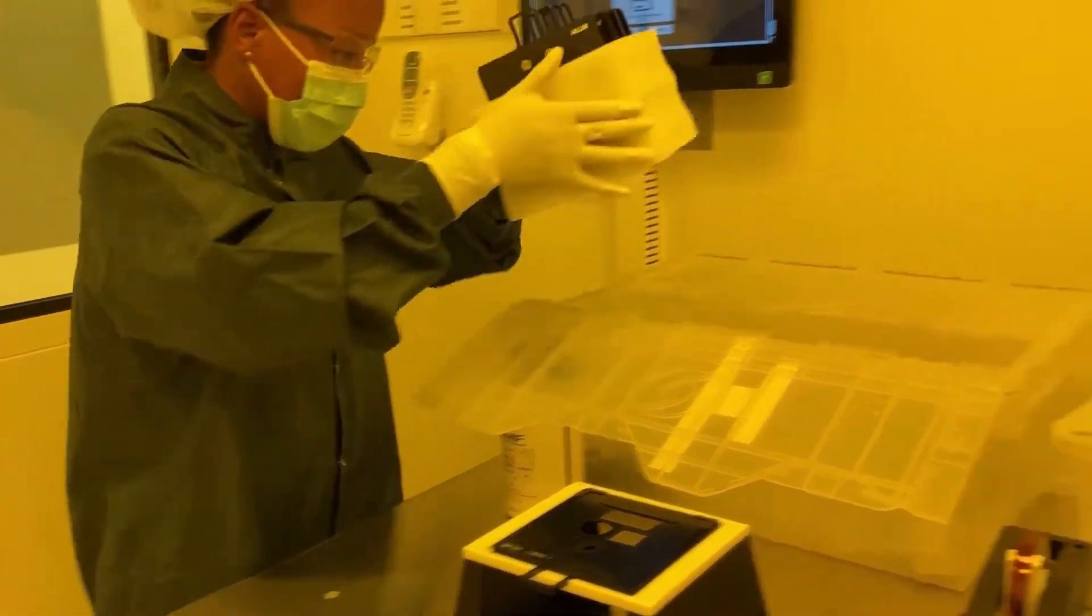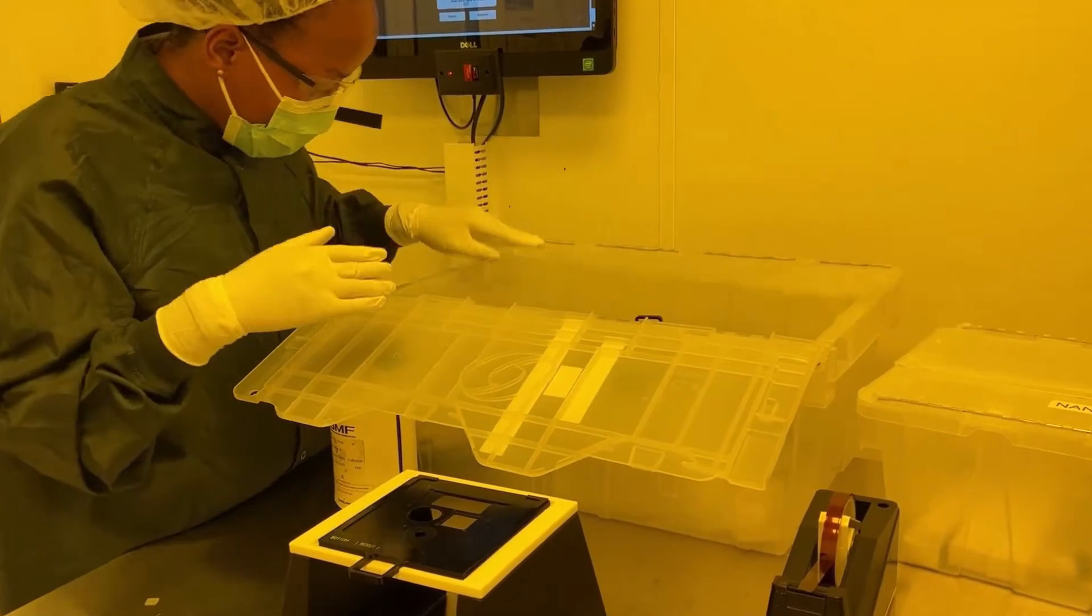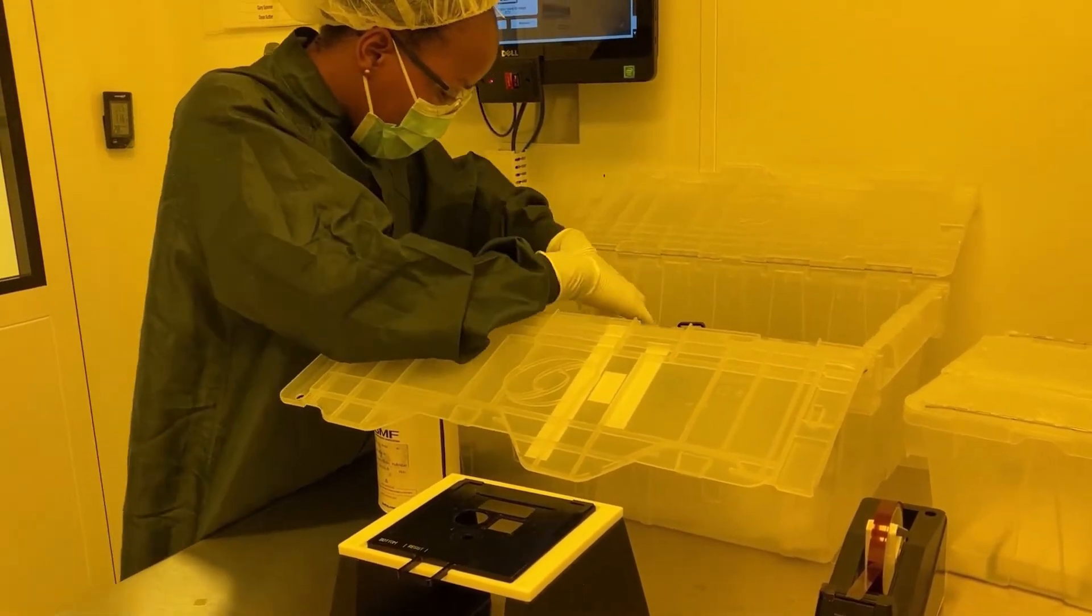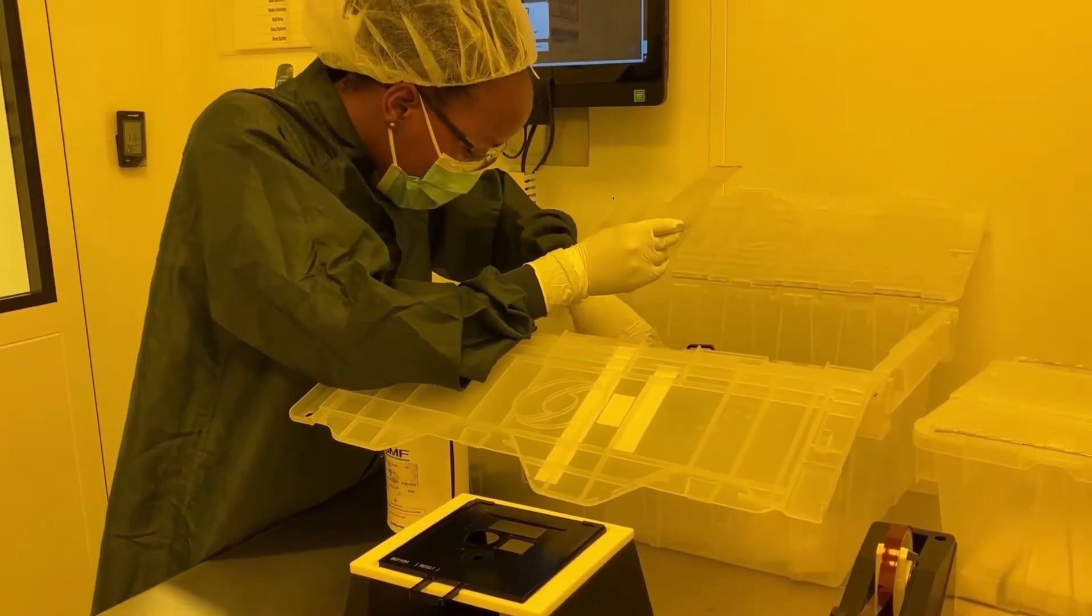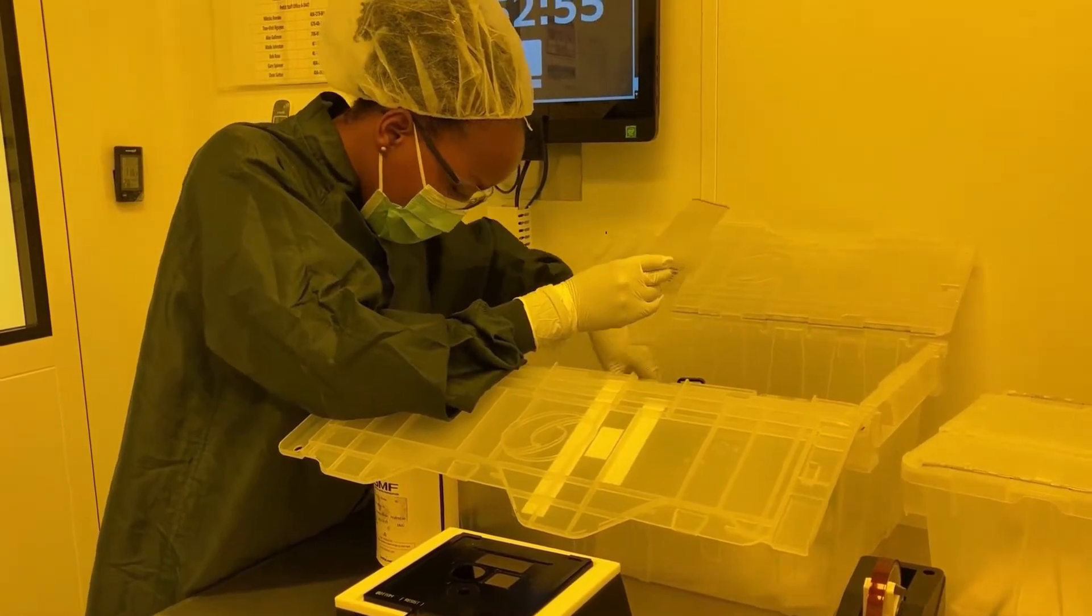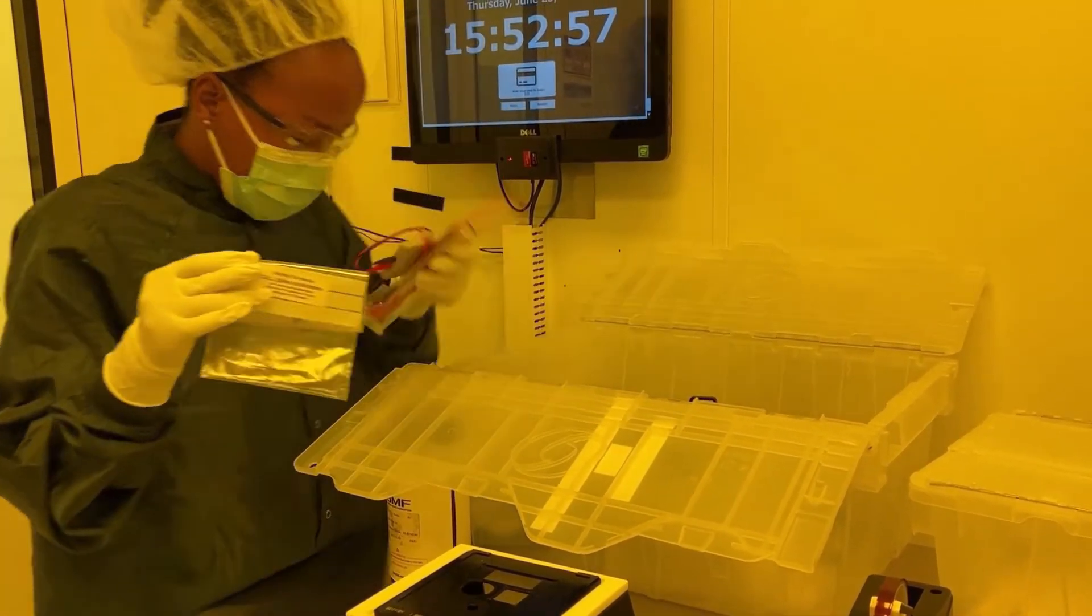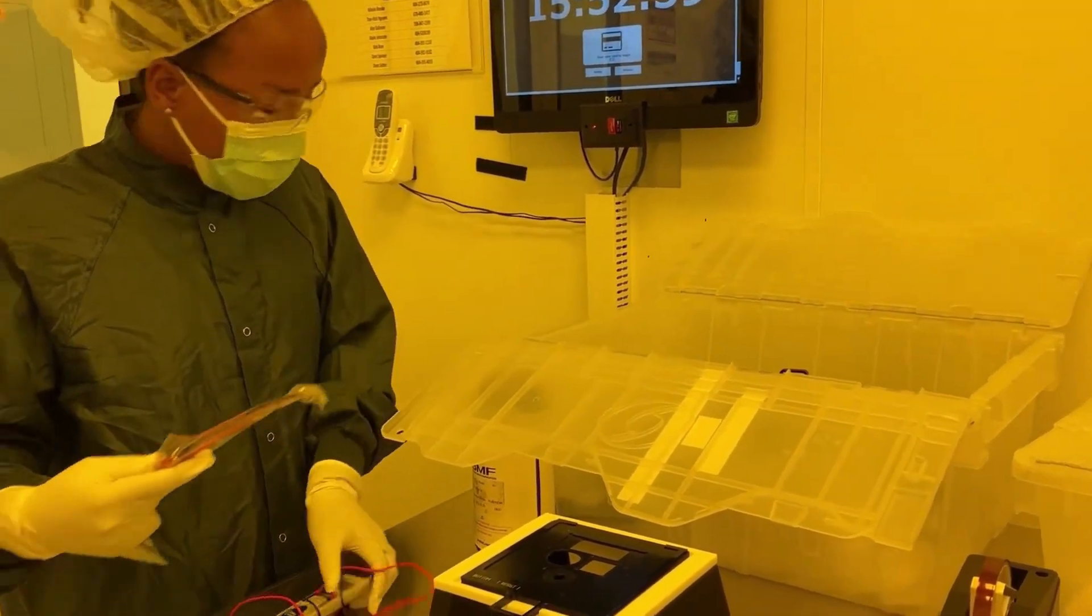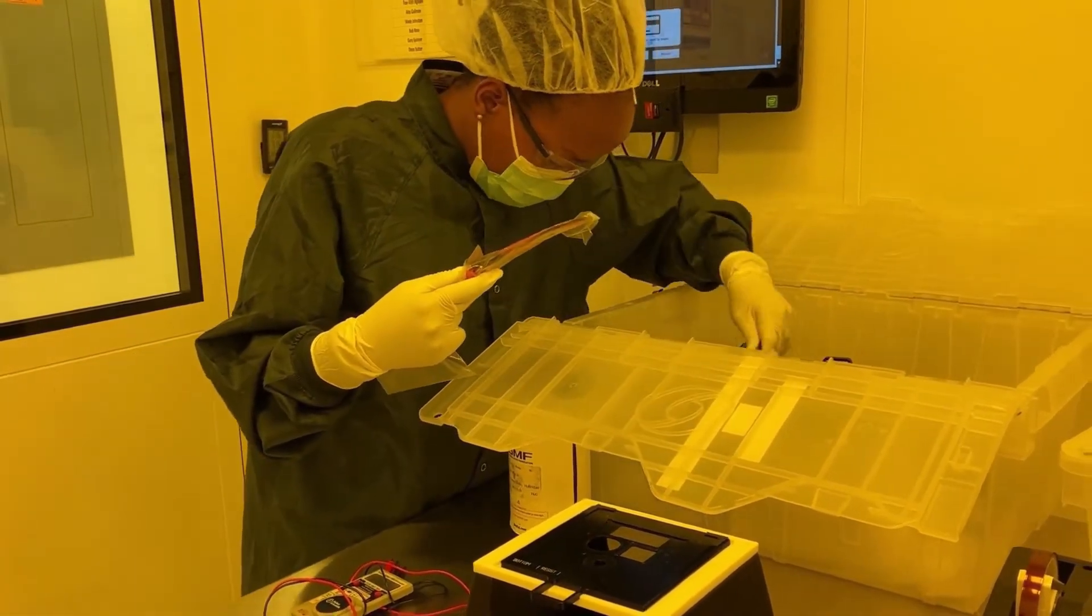Now, you can get the right substrate from the box. Here we are using a DIL substrate that is ITO coated; this can be used for a variety of different applications. You will also want to grab the multimeter so you can check which side is conductive when using an ITO coated substrate.